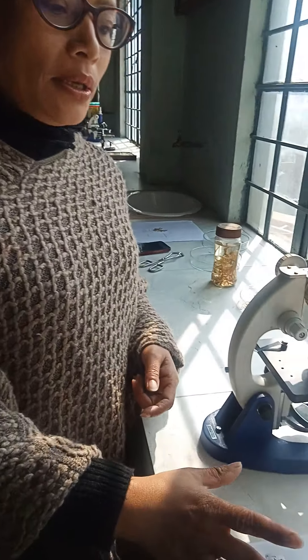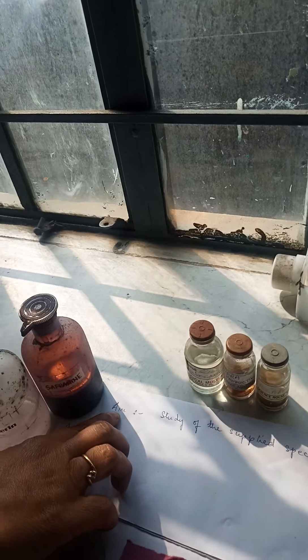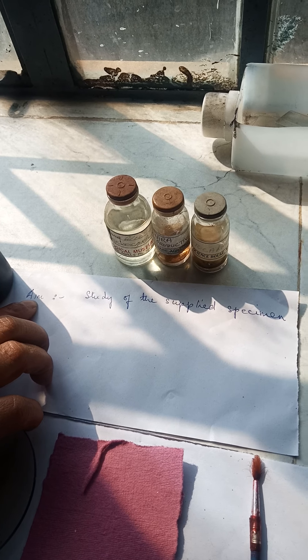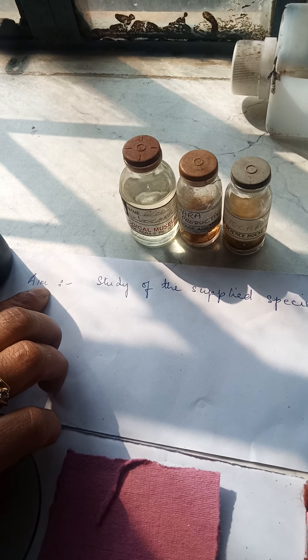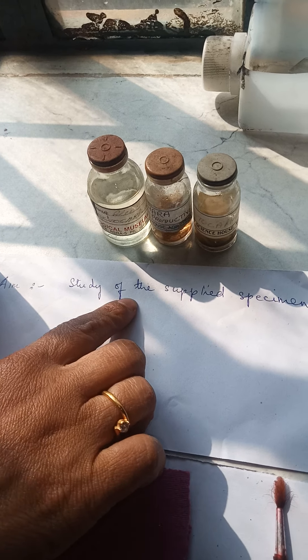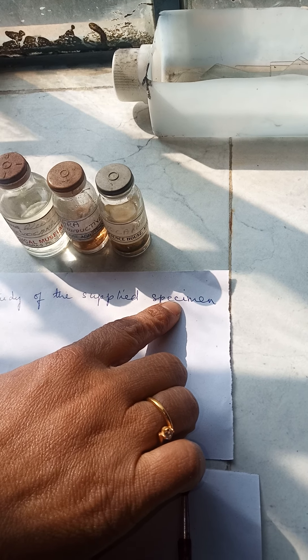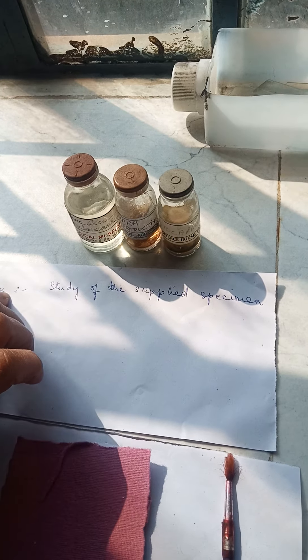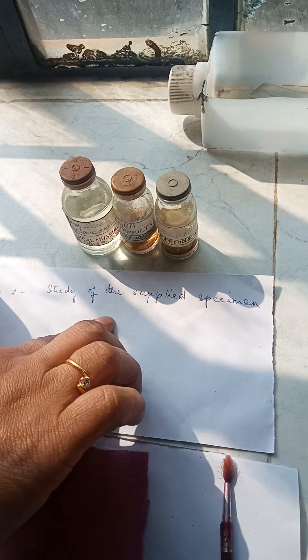Whenever we start a practical class, the teacher will write on the blackboard the aim of the experiment for the day. The aim is always 'the study of the supplied specimen.' So today we will be studying algae as our supplied specimen.